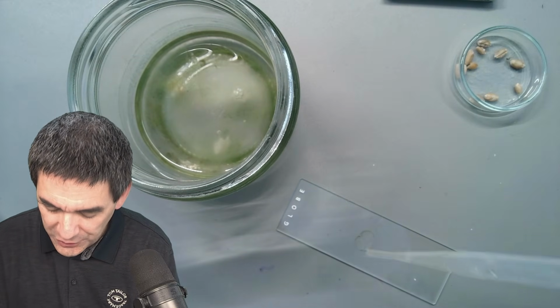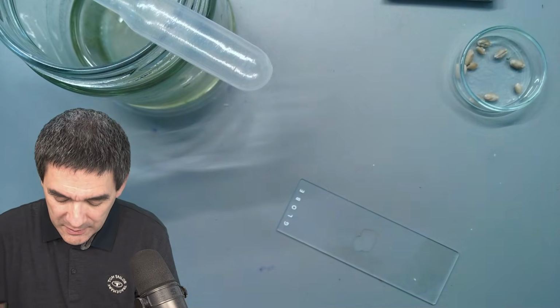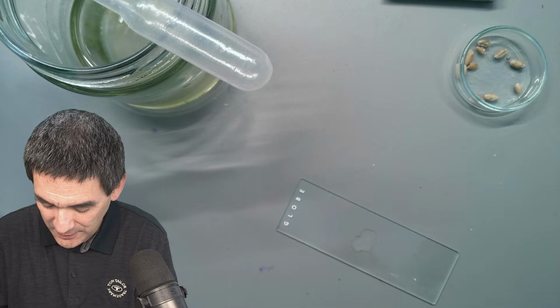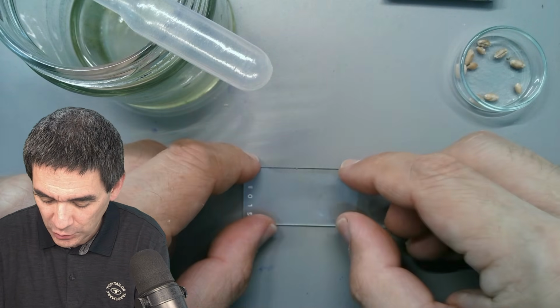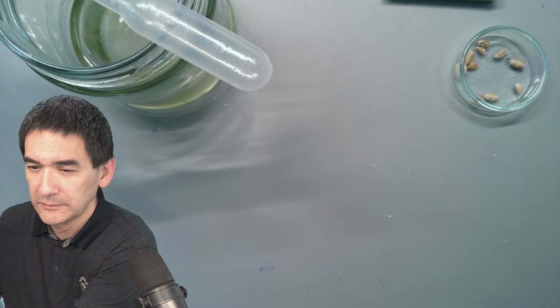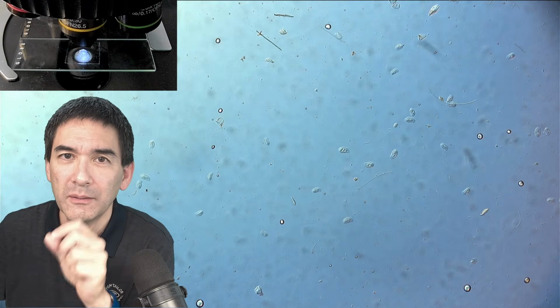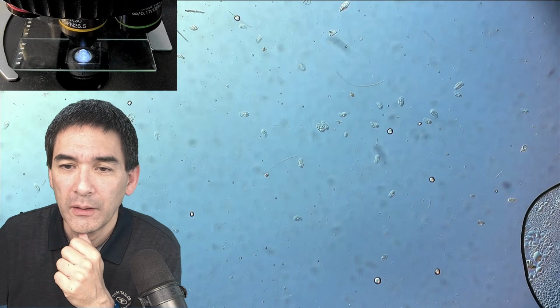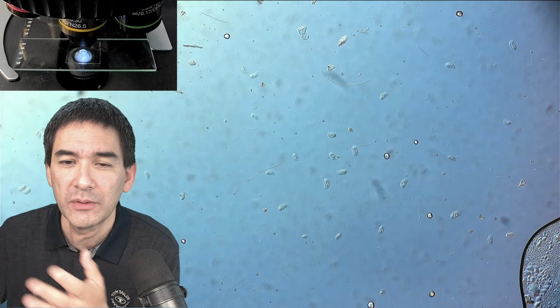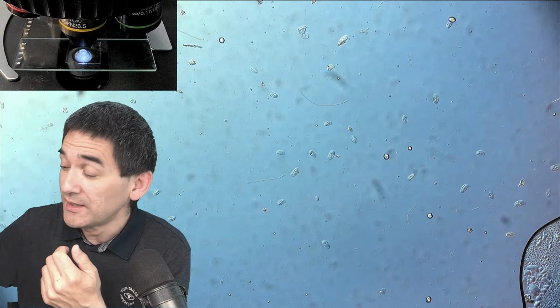Of course, you're probably also going to get fewer cells visible. But maybe you're able to see them a little bit better because there are fewer starch grains, right? As I just said, we drop a cover glass on top here, and let's have a look at this. So here we go. That is now the one where I did not poke all the way into the wheat grain. Now, the disadvantage here is that those ciliates are a little bit less inhibited, so they're able to move around more freely because they bump less into those starch grains. So that can actually be a disadvantage as well.